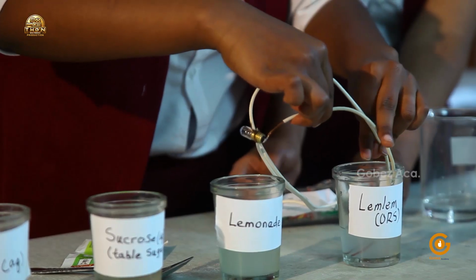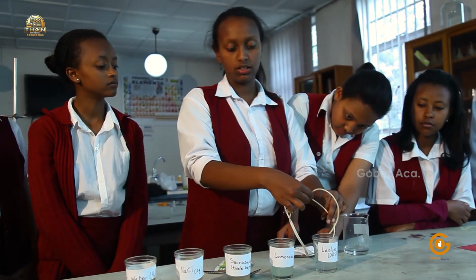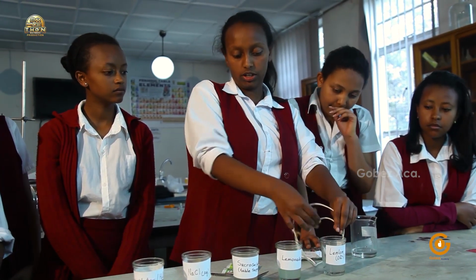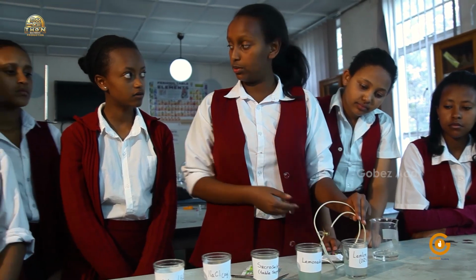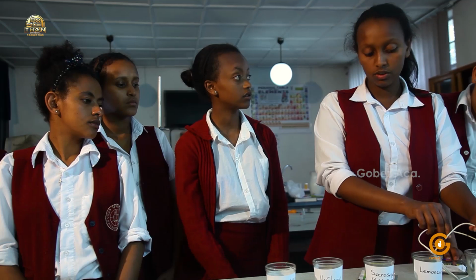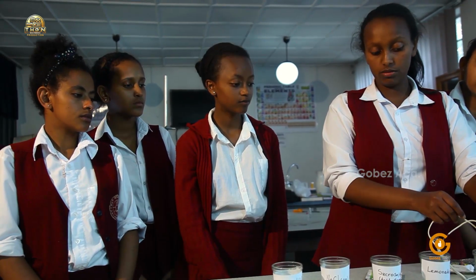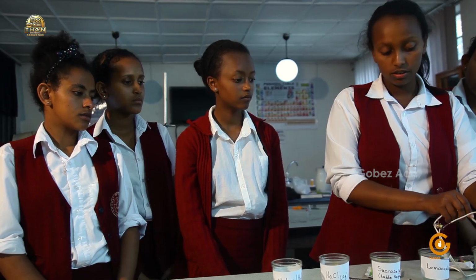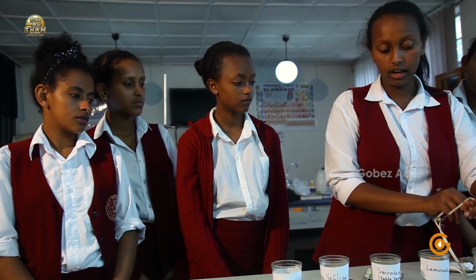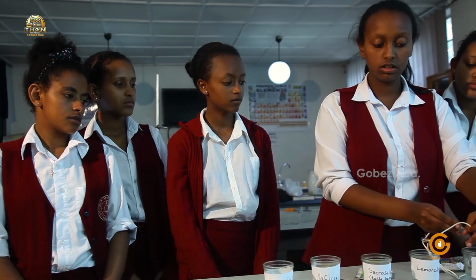Yes, slightly. But we had expected that ORS would be an electrolyte. So what do you think went wrong here? Can you give us a shot? The amount we added in the solution. I mean the concentration. Okay, so the concentration has an effect because we need many ions. No, the fact that it lit now is just because they touched each other. It's not because of the compound.